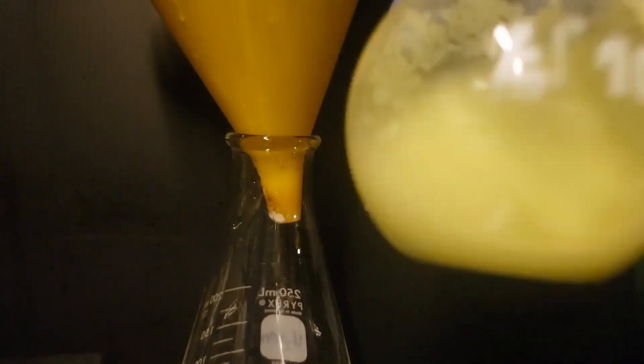Once this is complete, the yellowish tetrabutyl ammonium hexamolybdate precipitate is filtered off and then washed with three 20 ml portions of room temperature distilled water.